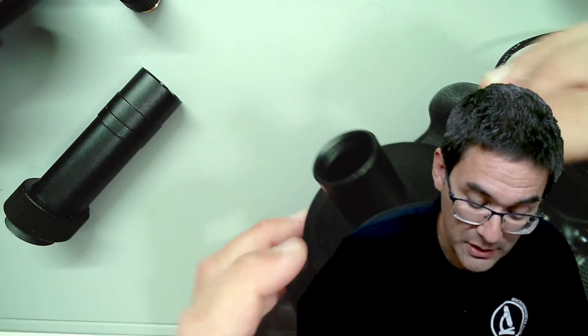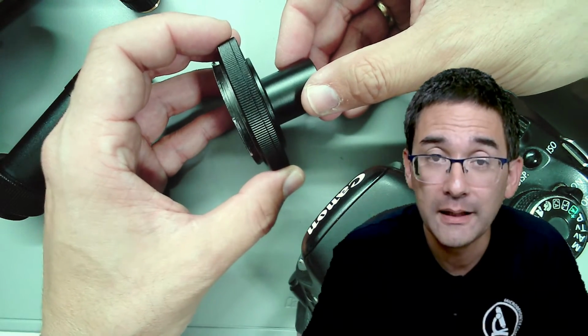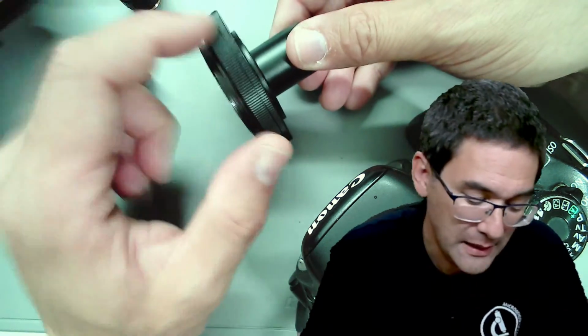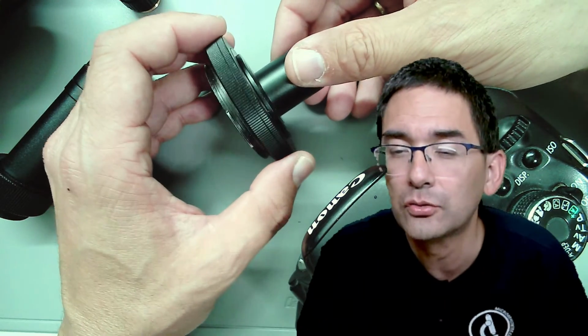So those very cheap adapters without optics are cheap. That's the advantage, but try it out. I think it has limited usability. So there are now a few more questions that I would like to read here.